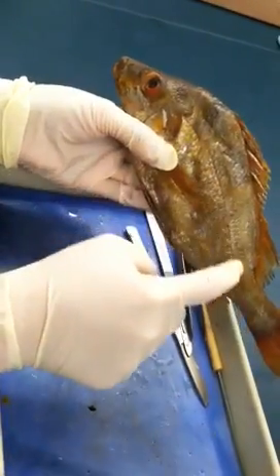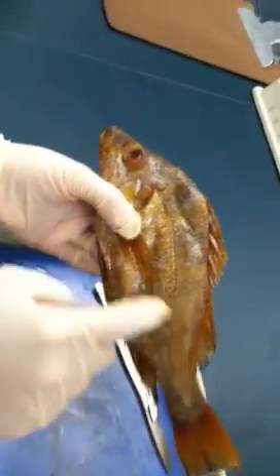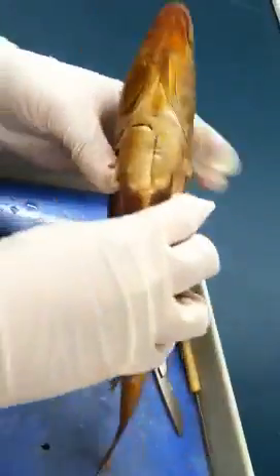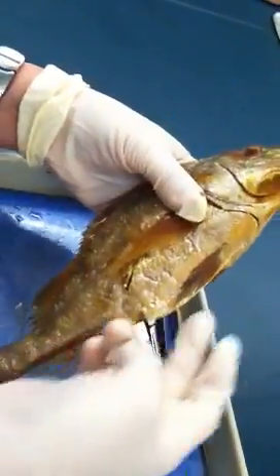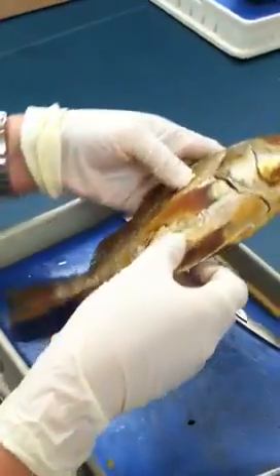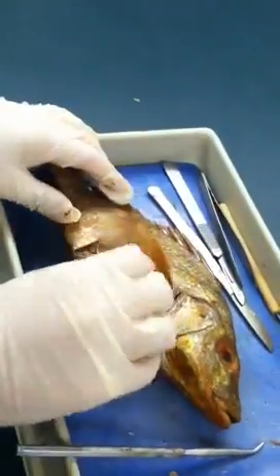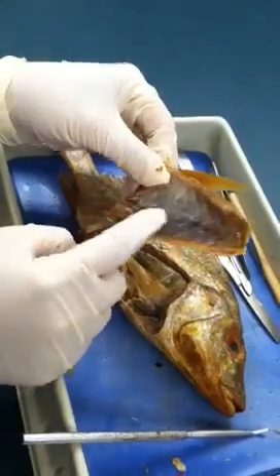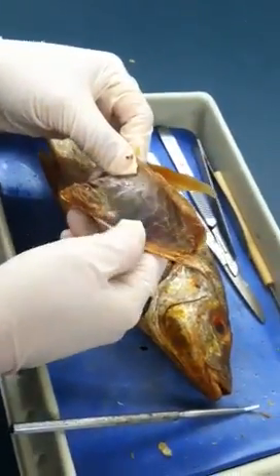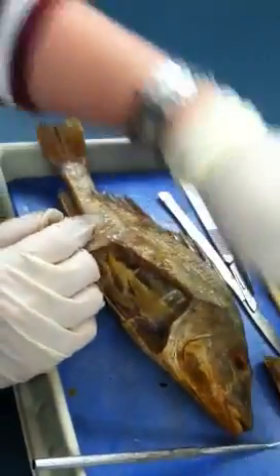And then this line is what we call the lateral line. So when we do dissection, we actually cut from the anus and go all the way up along the lateral line. Now I have to open the fish up. This is usually what we eat for fish — that's their muscle, what we call myomeres.